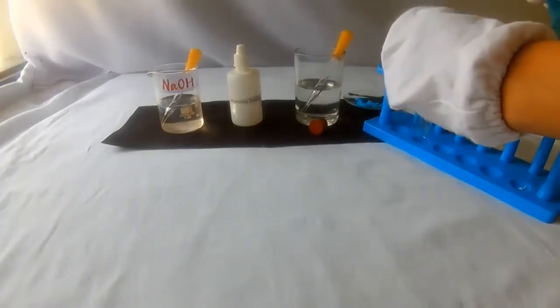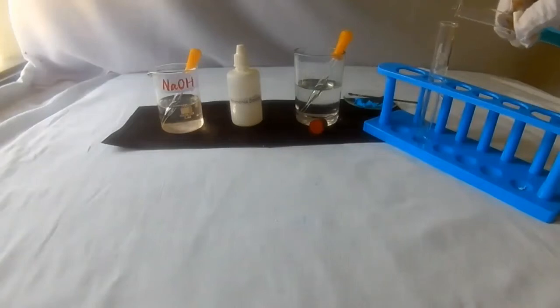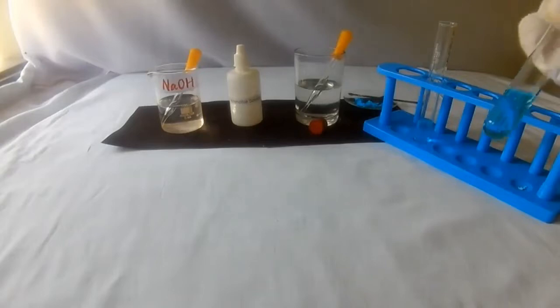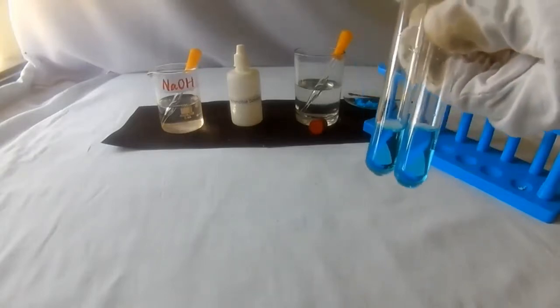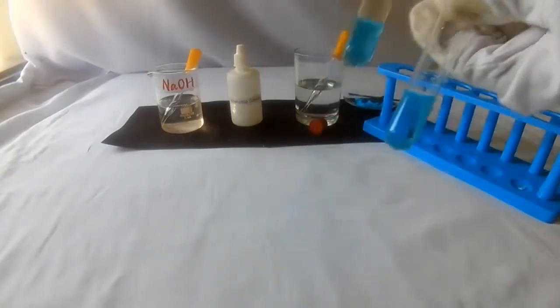Divide the solution into two equal parts. For this, take another test tube. Pour the solution to the other test tube. It is ready.